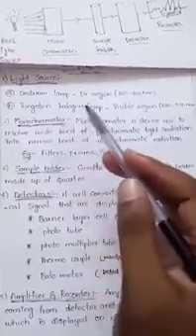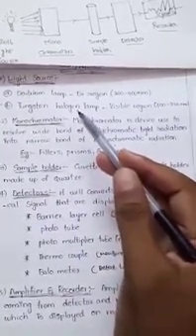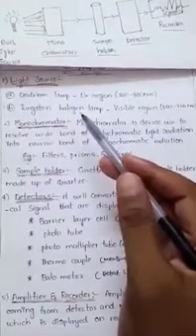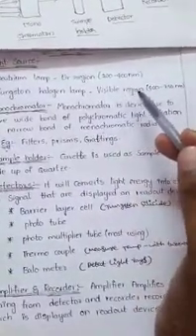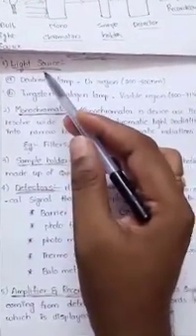Tungsten metal is mixed with any halogen element. Halogens are mainly four halogen elements. The tungsten halogen lamp allows the visible region, that is 400 to 750 nanometers. These are the two lamp sources used as a light source in UV visible spectroscopy.